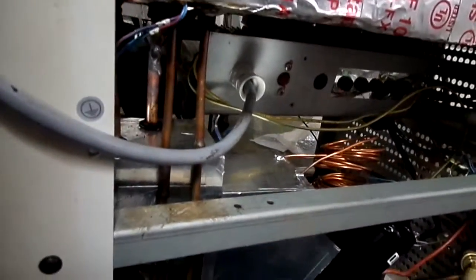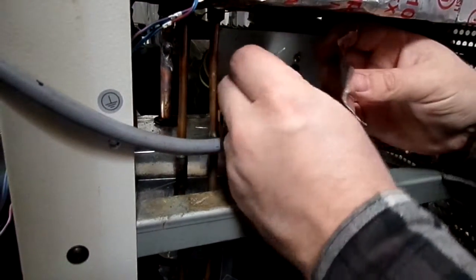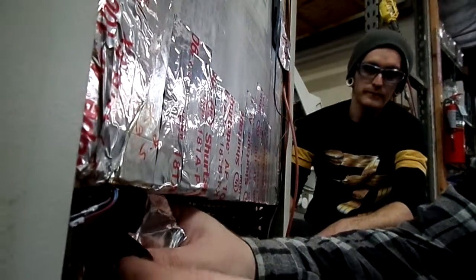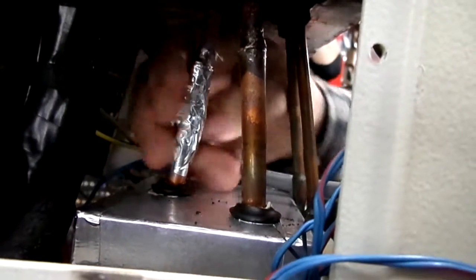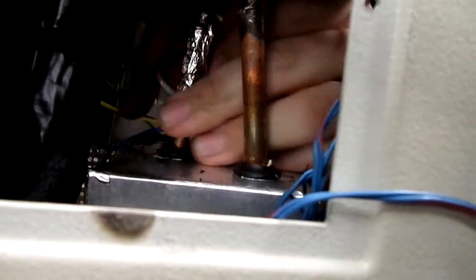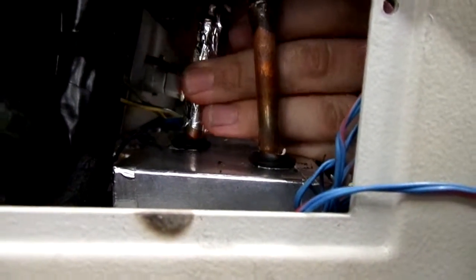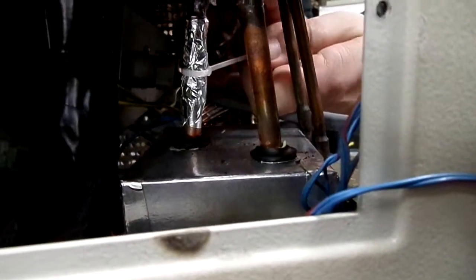Again, we don't use the little thermocouples like it does. I mean, you can, with a little bit of savvy. If you're good with your meter, you actually use your meter with the probes on the temperature setting instead of using the thermocouple hookup. And again, when you're taking these sensors off, just make note of where they came from. They're all numbered. Very easy to keep track of, unless you're stupid like me.